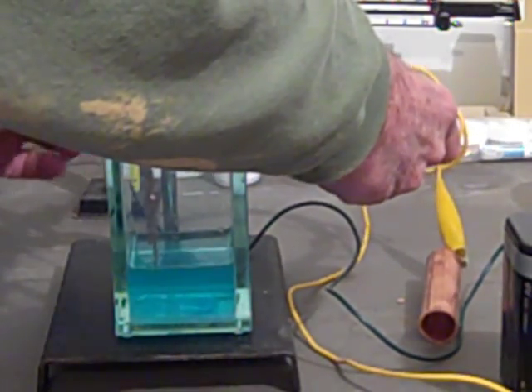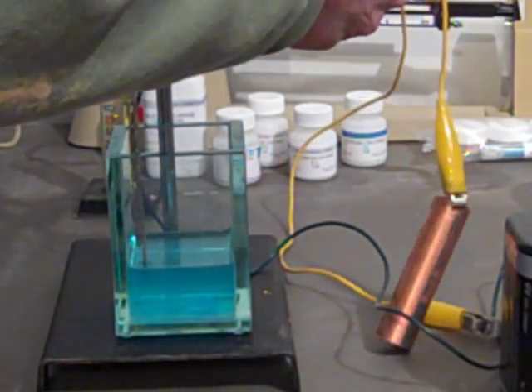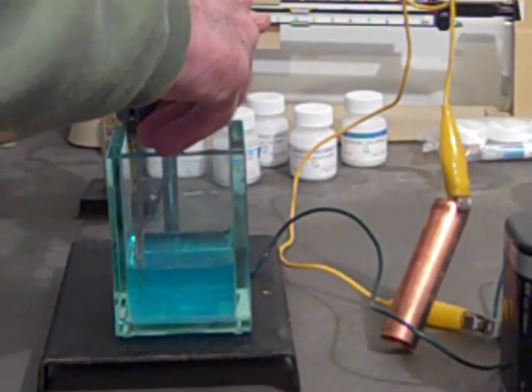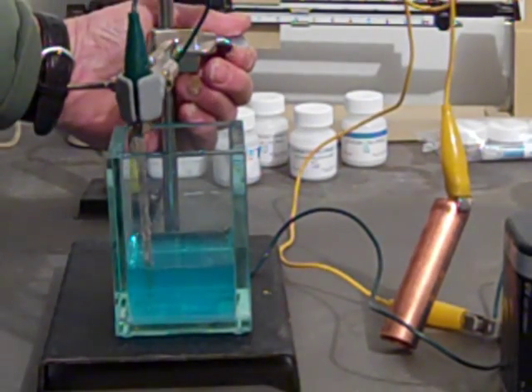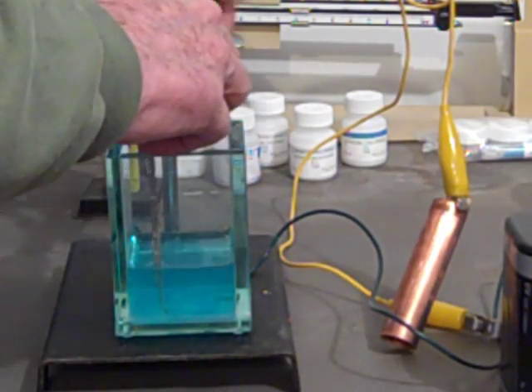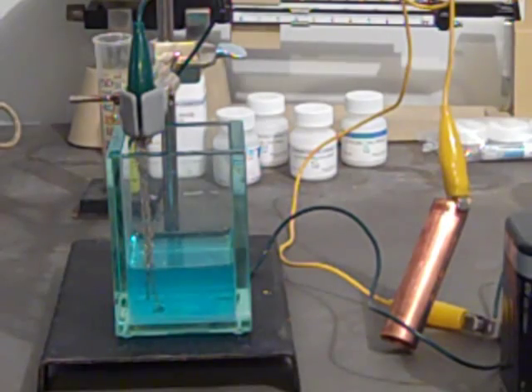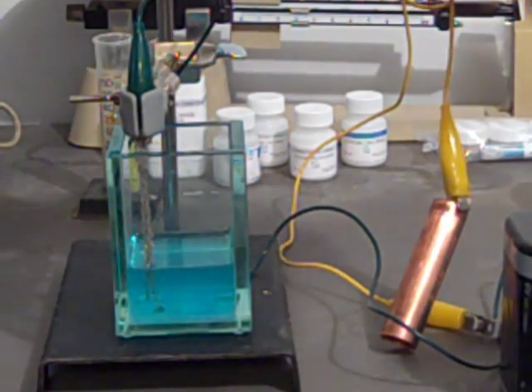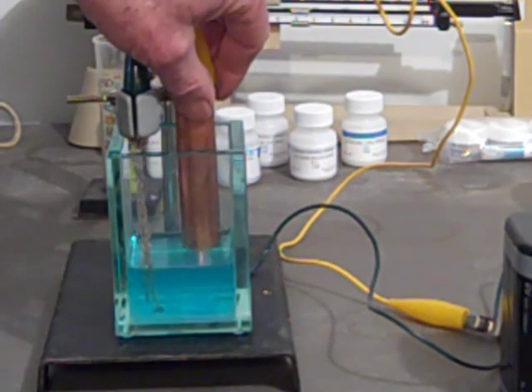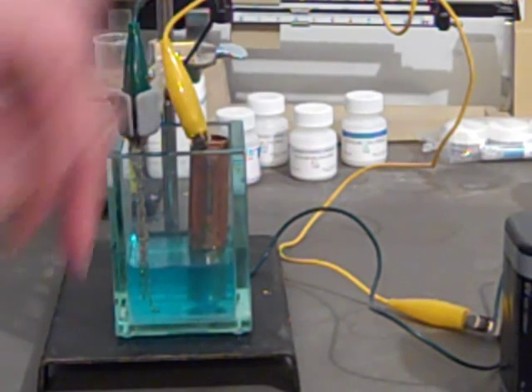It's in our solution — just below the surface there, just a little bit of silver. We can put some more through. I don't want it to fall through. Lower it down a little bit more. You can see it touching the bottom of our copper sulfate solution. And here you have our clean copper tube — whatever you have that's copper will work fine. We're going to put the copper tube way to the back so that it can't come in contact with the silver.